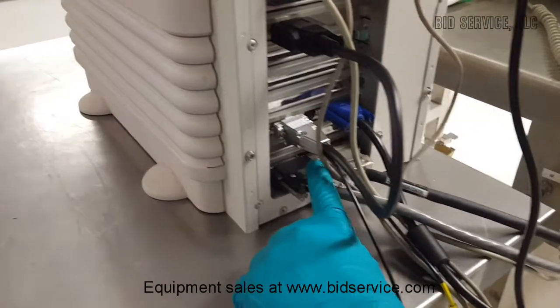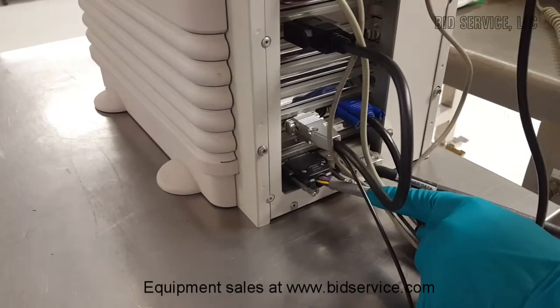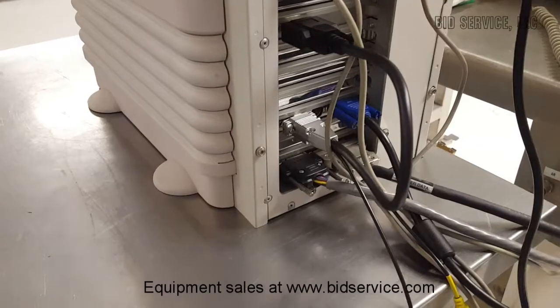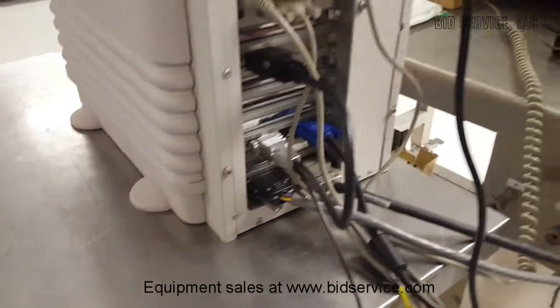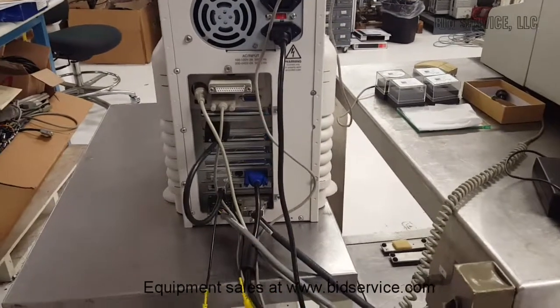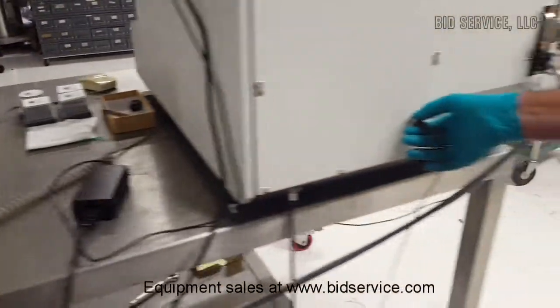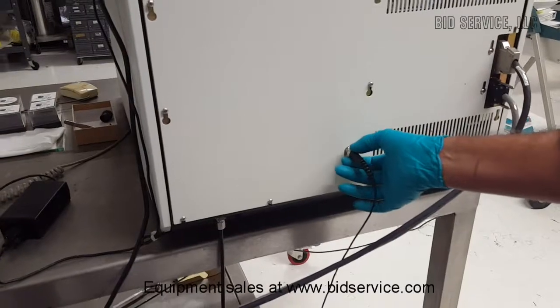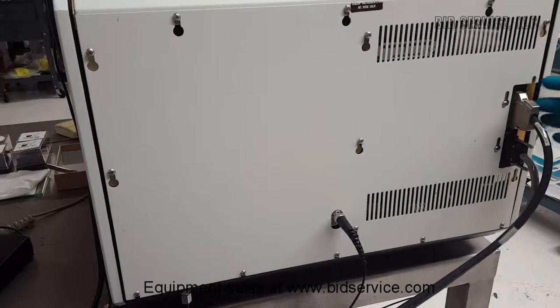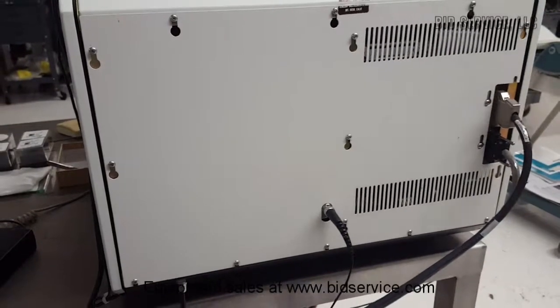And these two connectors, the scanner power and the scanner data cables, are to be properly connected on this end. And also there's a video zero signal which goes from the camera to the PC through this BNC connector here, and these are the cables, the scanner power and data cables connected to the machine here.